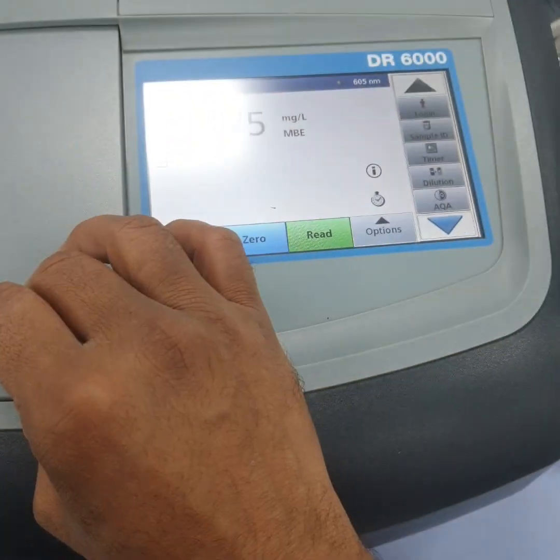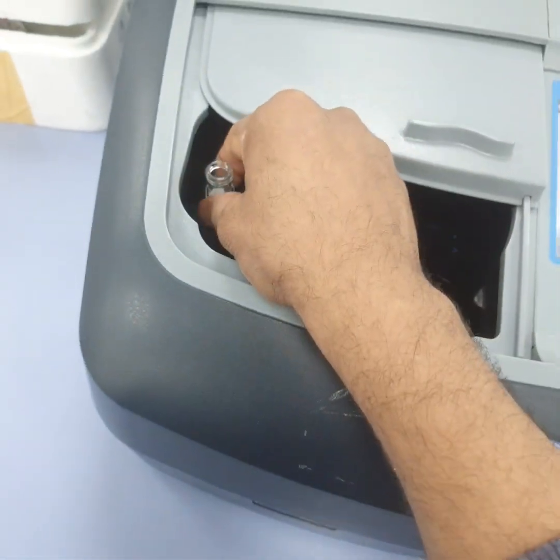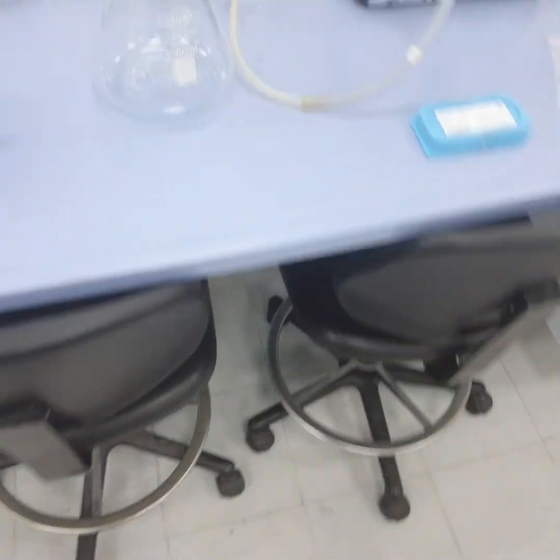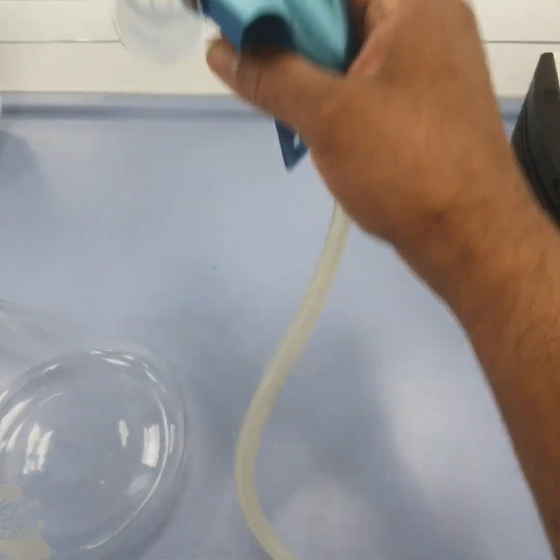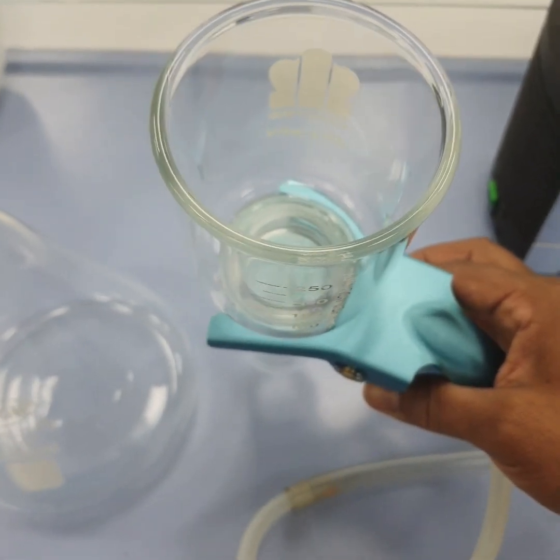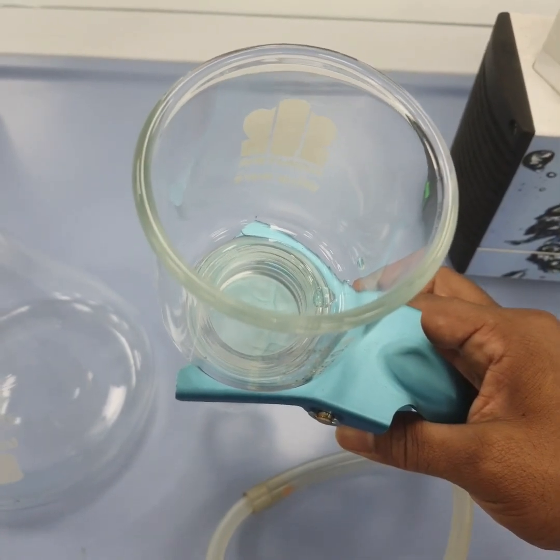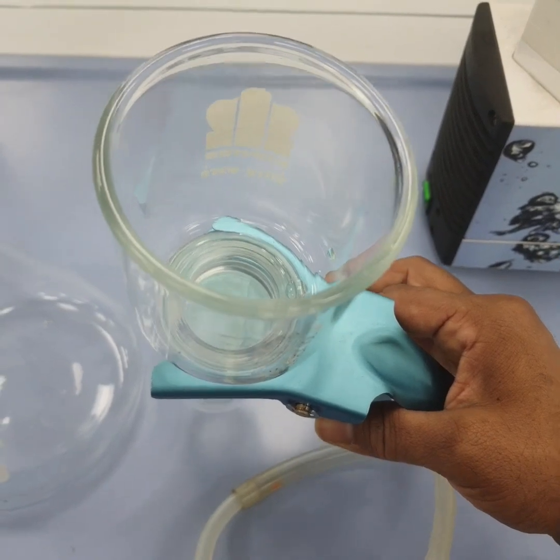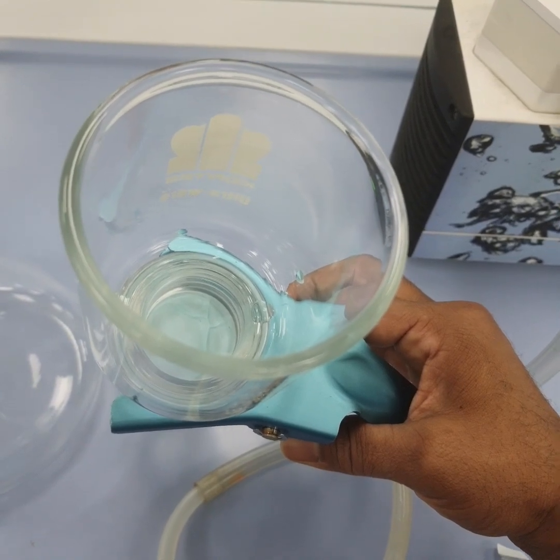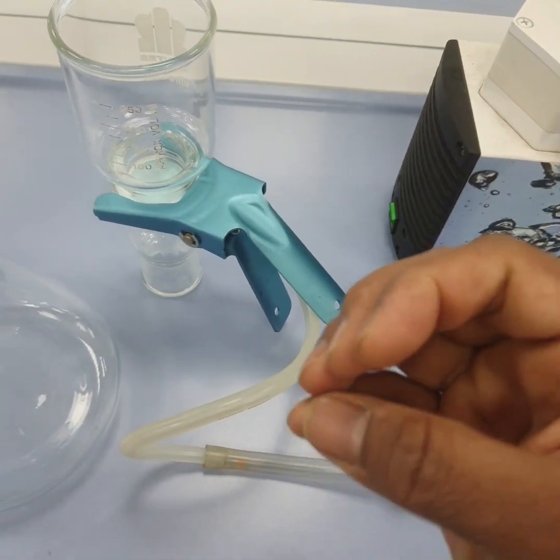So this was all about the cellulose acetate membrane. Let us now check the other membrane, and also we can regenerate the membrane. This membrane can be regenerated by soaking in some specific kind of eluent or solvent like HCl or nitric acid, not the concentrated one, but lower dilutions like 1 molar or 1 normal, or other agents like alcohol, ethanol, or acetone also. This all depends upon our objective. So this is basically for the regeneration.